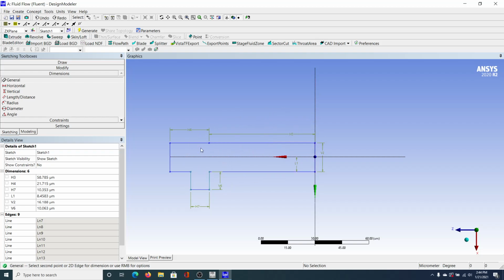So now it seems we got all of our dimensions to define. As you can see here, we have all our dimensions, and we're going to set them. So H3, let me check my notes here. H3 was 1600 micrometers. That's basically the distance from here to here, the mixing channel, if you will. So I'm just going to click here, H3. I'm going to click on that value and type in 1600, hit enter, and it's going to make that dimension longer.